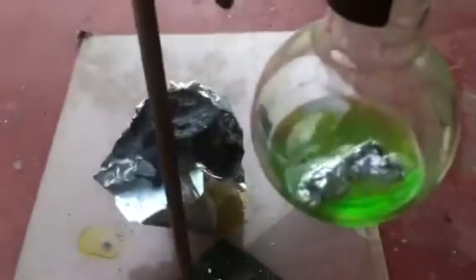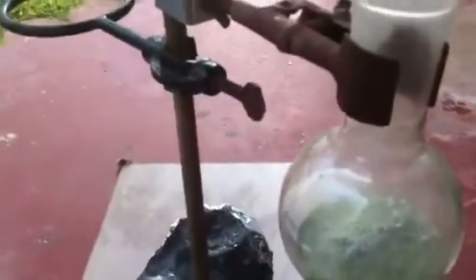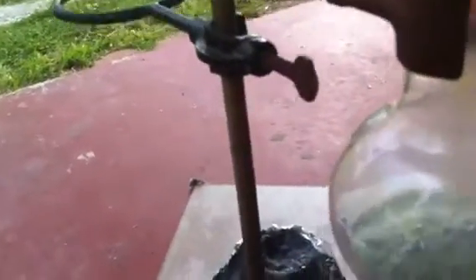some aluminum to it, which will be right now, and I will get a reaction like you saw last time, and I'm going to let it fill up with gas so it can actually explode on me. And the word explode, you probably now finally guessed what I'm going to do. Light it on fire, which you might be able to see in there. Nope, didn't. There we go.